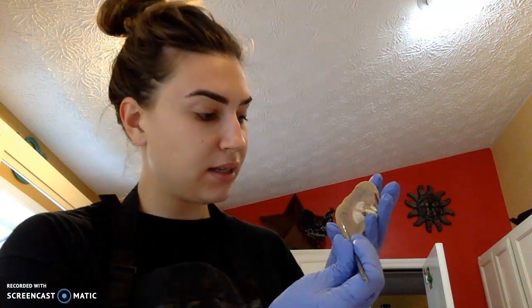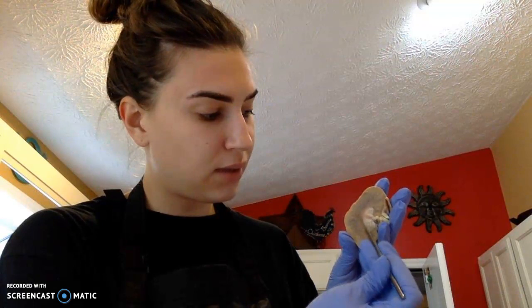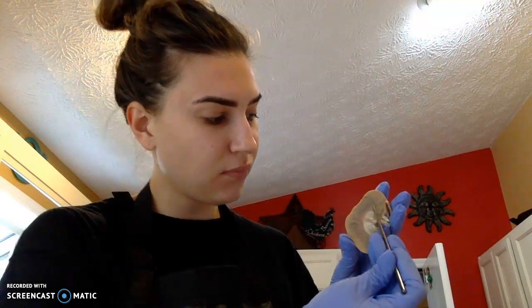Located within the renal medulla are going to be our renal pyramids. There's about 6 to 18 of these. They're located within the renal medulla. Dividing the renal pyramids from one another is cortical tissue. It'll be located in between the renal pyramids, and this will be called our renal columns.